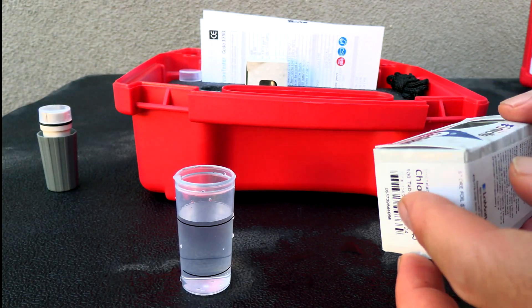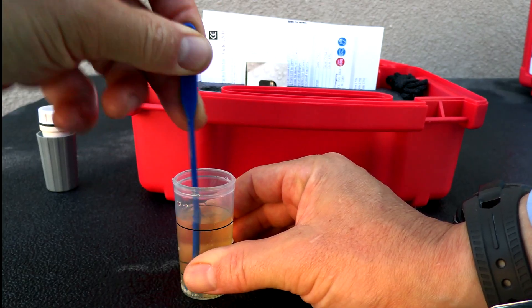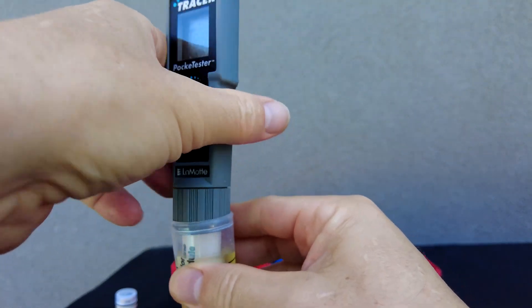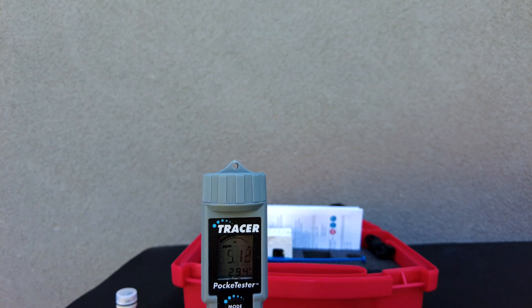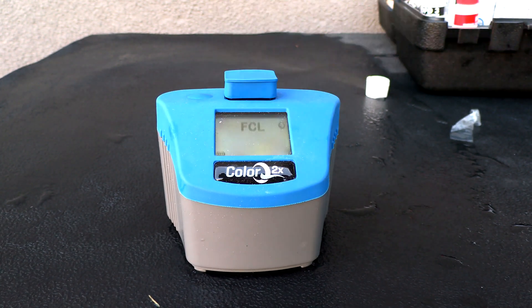There's one extra step required to get the chlorine test — you want to put a chlorine tablet in each time you run the test. Once you have the tablet crushed, put the cap on the sample cup and shake it vigorously for about 30 seconds. Turn the Tracer unit on, dip the chlorine module inside the sample, and swirl around for about 10 seconds. The chlorine reading is coming in at 5.2, which is matching up well with the pocket tester.